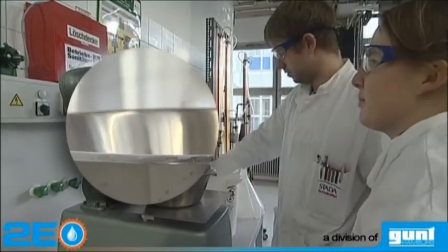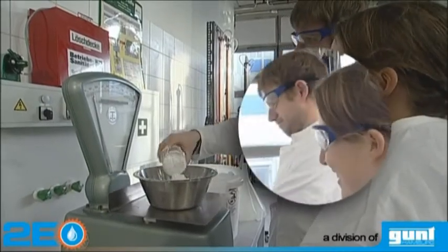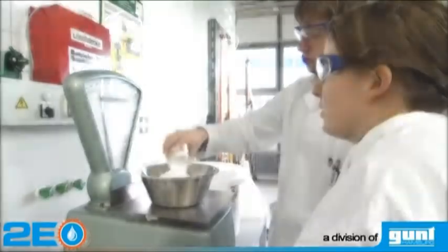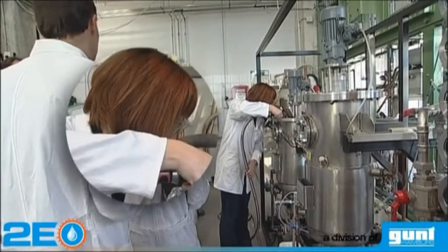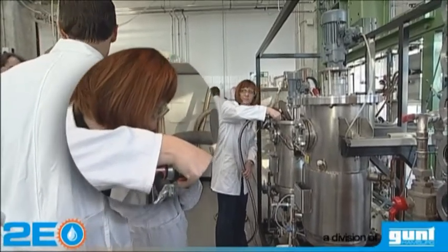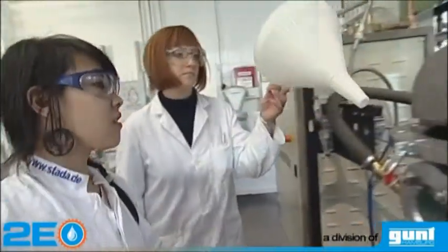To prepare for the process, starch extracted from potatoes is weighed. The mash tank is filled with a water and starch mixture and heated.